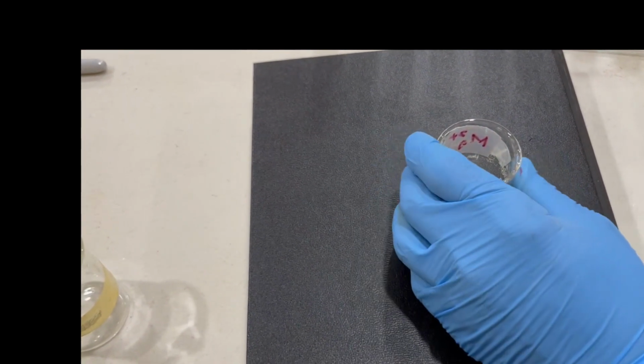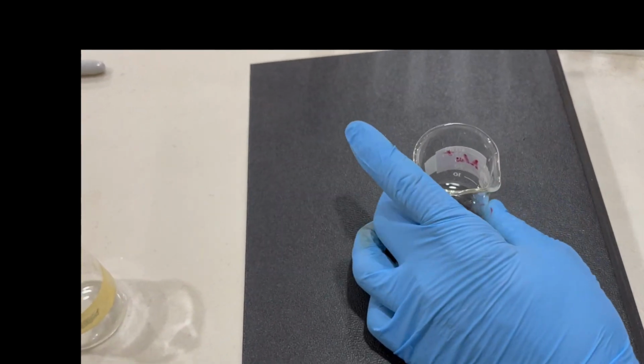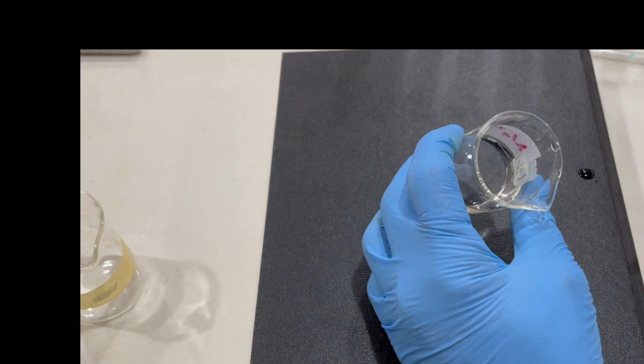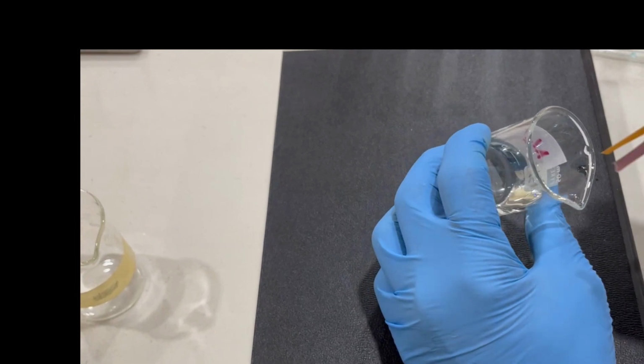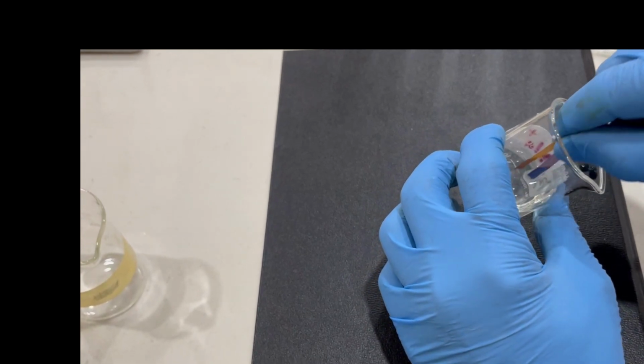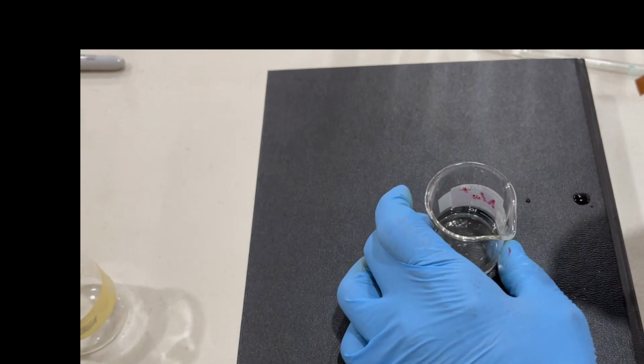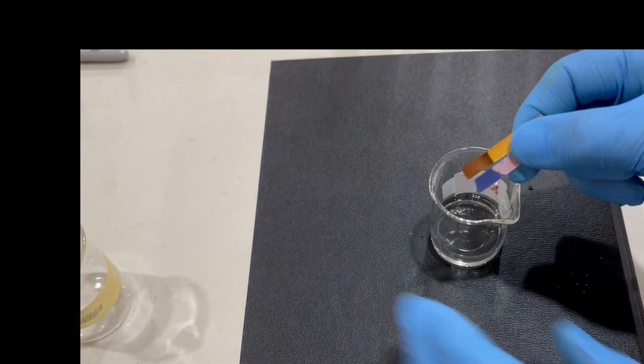There's a third type of double displacement reaction in which you do not see a precipitate, and that is between acids and bases. The reaction between an acid and a base does not produce a precipitate, so you won't be able to say whether or not a reaction is taking place. But you can see that by using indicator paper. So here's a base here. It changed pink litmus paper to blue, and that's the color on pH paper, right?